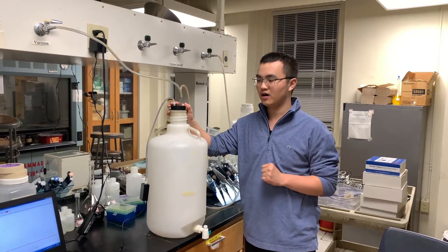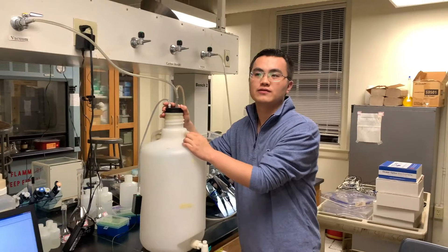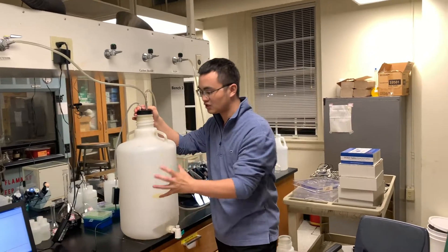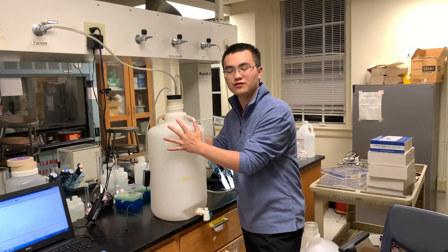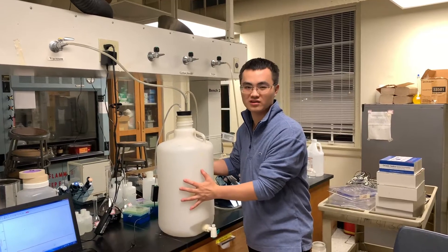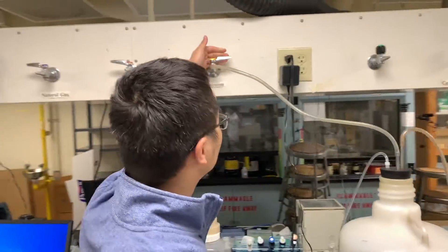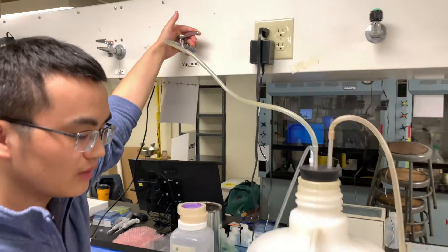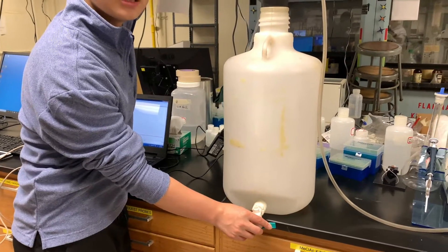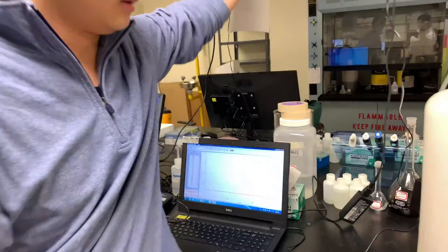Now we have successfully finished the introduction of the experiment. We are moving to the next step of the real experiment. We will do some preparation work before actually determining the CP/CV ratio for argon. One step that needs to be finished is to purge the system with argon. To purge the system, first we have to use a vacuum to remove the air out of the carboy, to remove all the air and gas impurities. We must make sure that the valve for venting the gas in the carboy is closed.